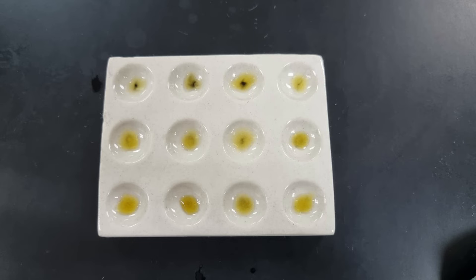However, in the fourth well onwards, the solution remained yellow. So the iodine test is negative, telling me that at 60 seconds, which is in the fourth well, this reaction has been completed.